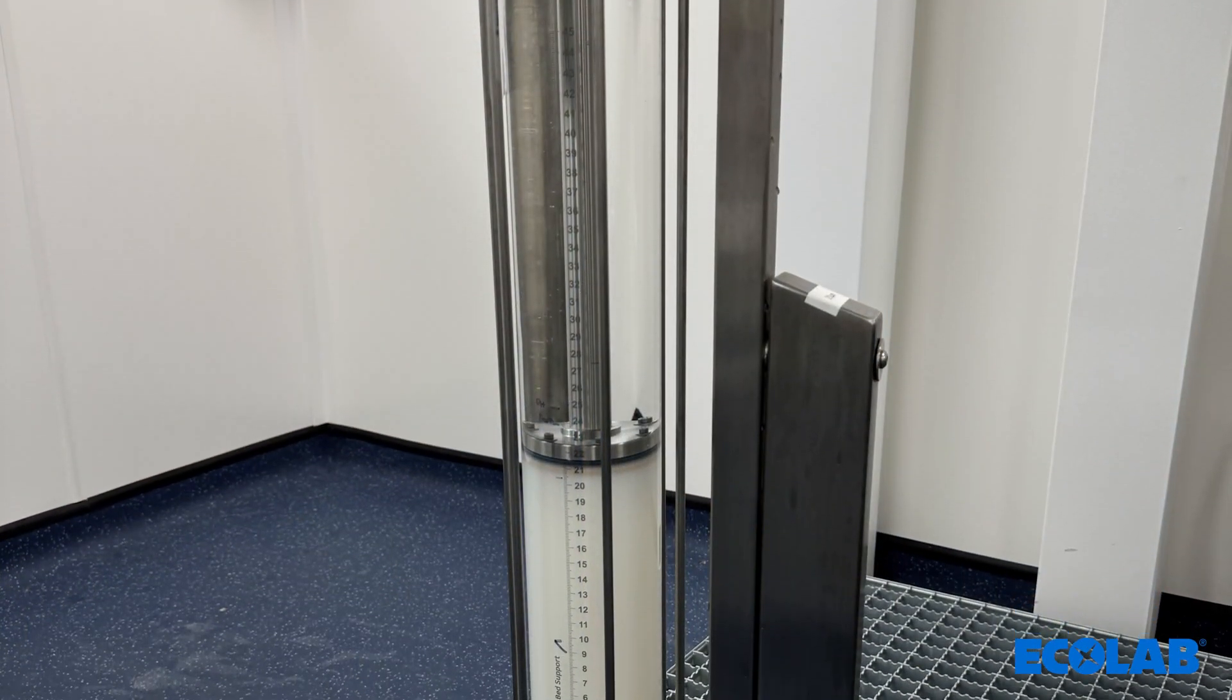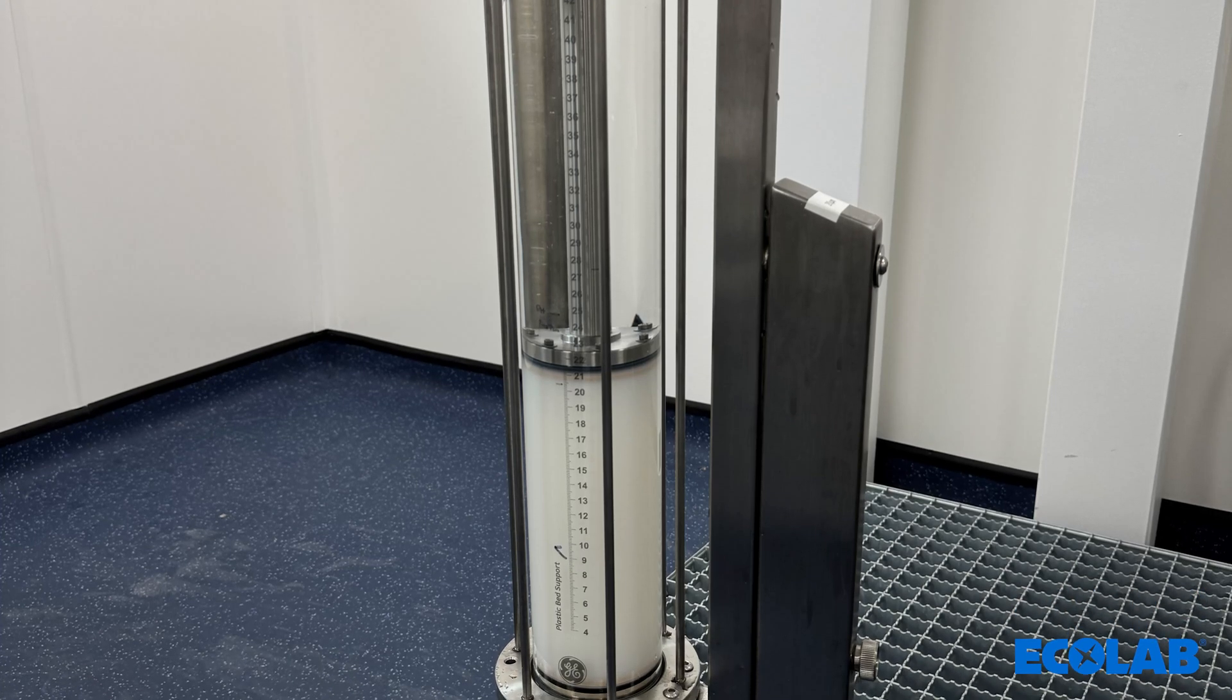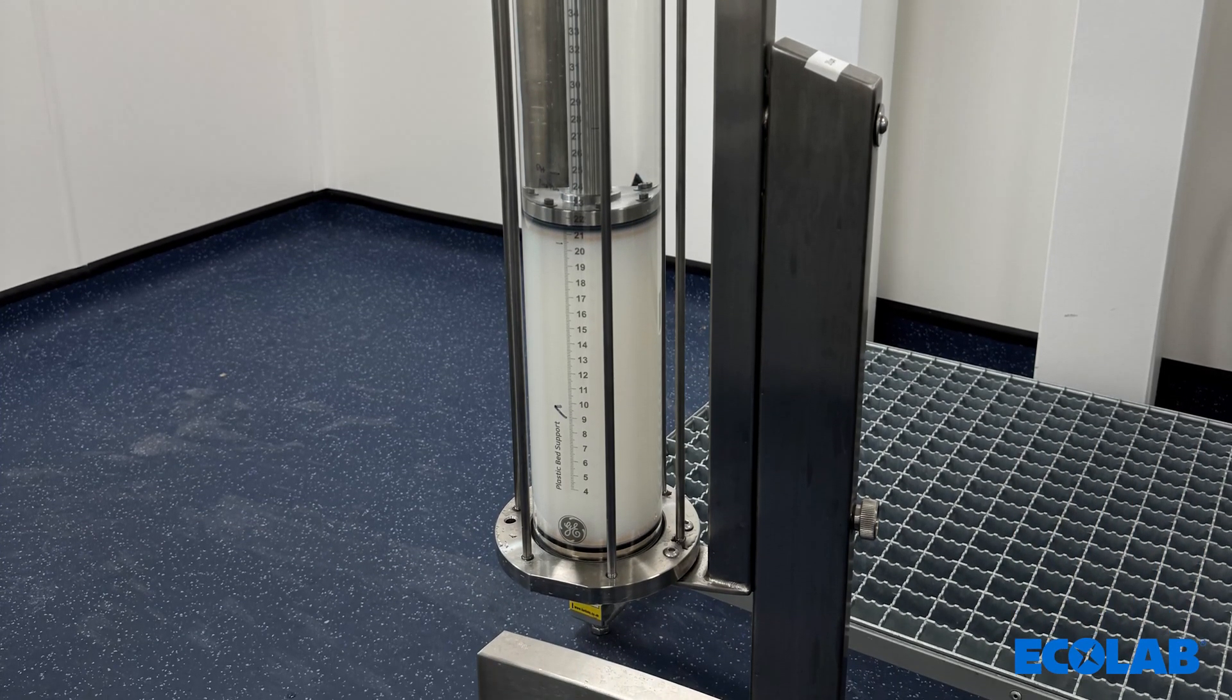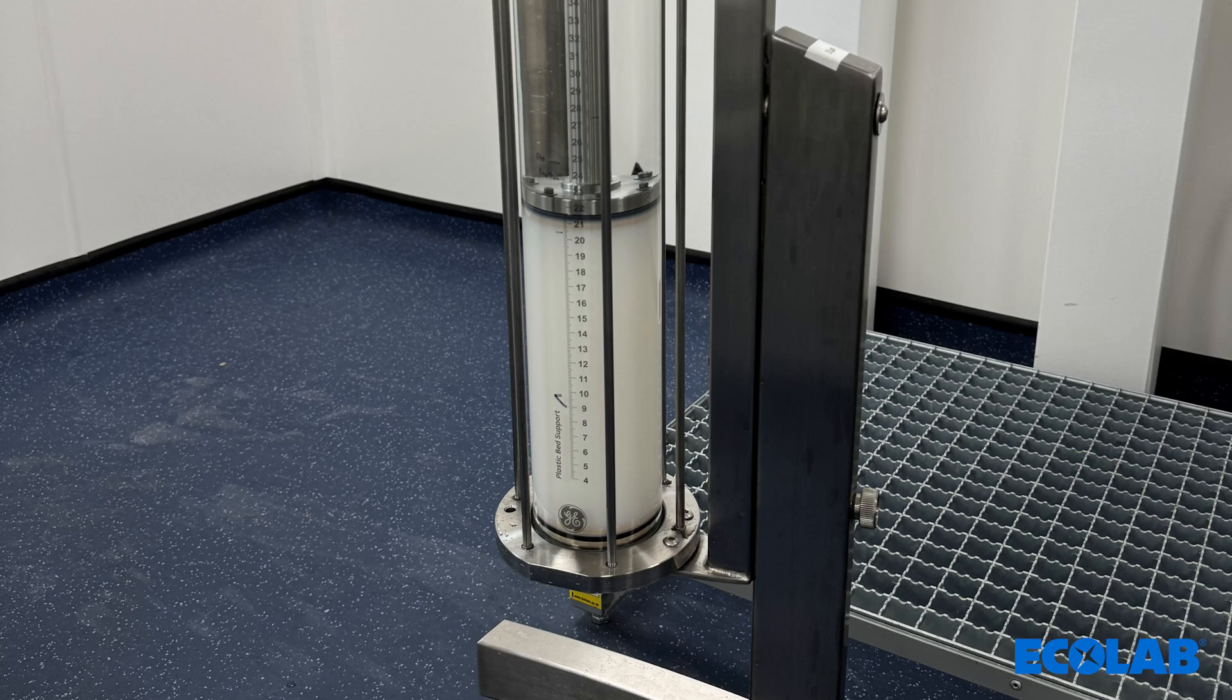Once the packing factor is reached, the adapter will stop and the packing is complete. A conditioning flow of two column volumes is recommended to be performed, and the column is now ready for column efficiency testing.